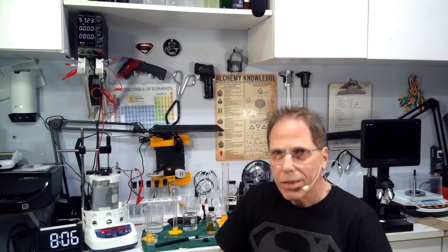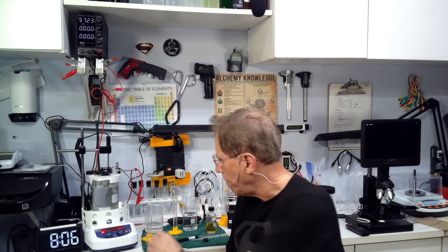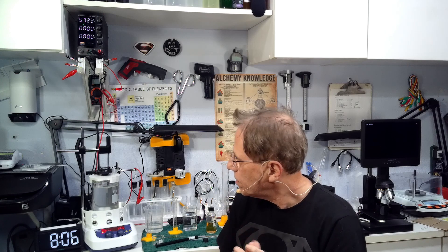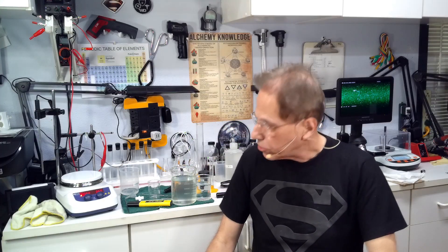I plan to look into other reducing agents that might be able to go further down the road, but this gets us platinum in the door. Welcome back, we're at the eight hour mark and I've stopped the process. I'm going to let the rod dry out a little bit so I could get a weight on it to give some idea of how much material we have off it.